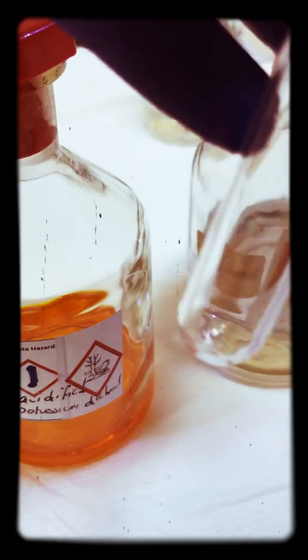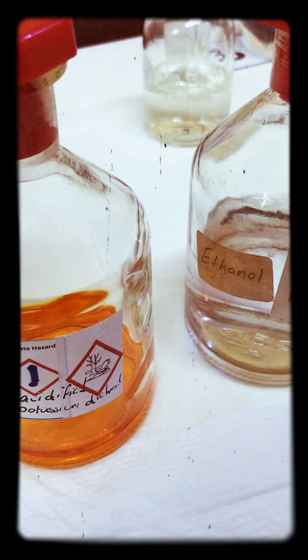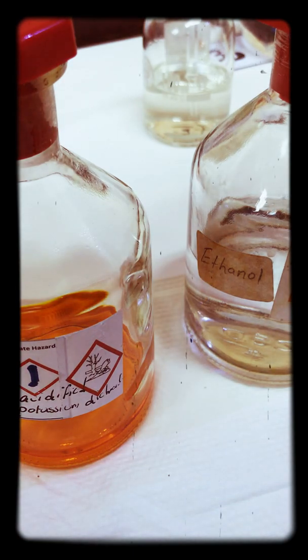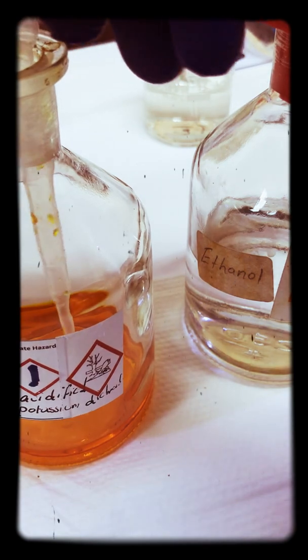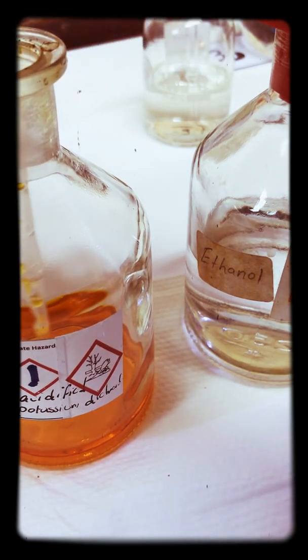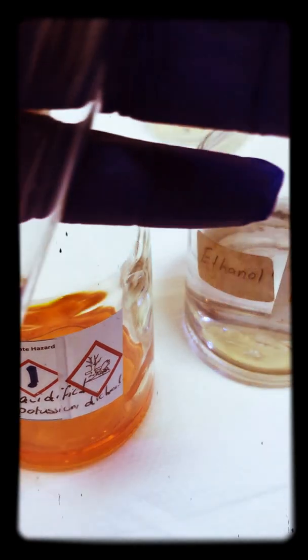Now this does actually take a little bit of time, but what I have done in advance is I have done this experiment about ten minutes ago. I also have a test tube that shows the results of the experiment from yesterday to have an appropriate comparison for a video.